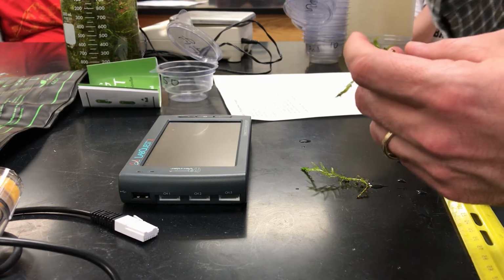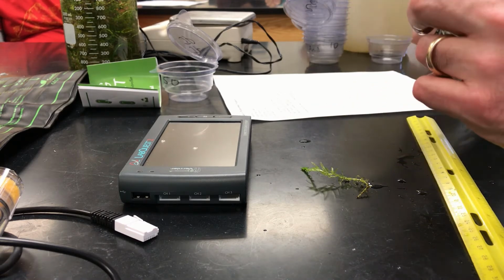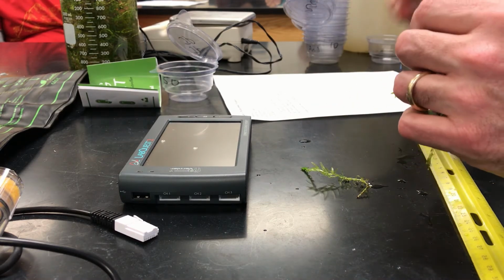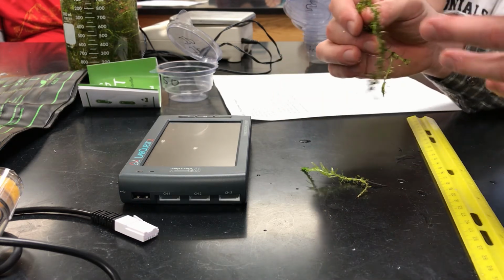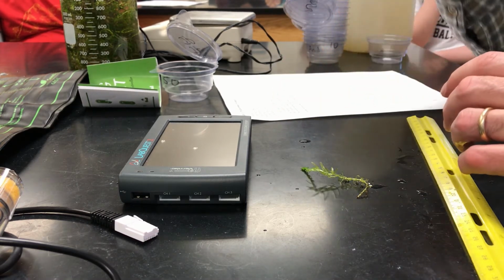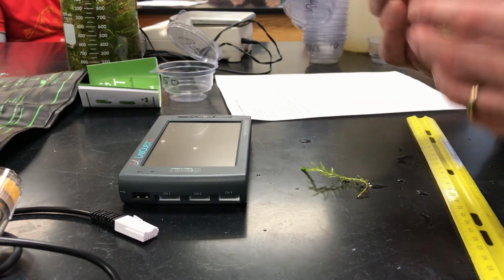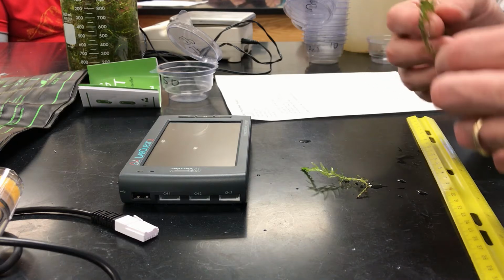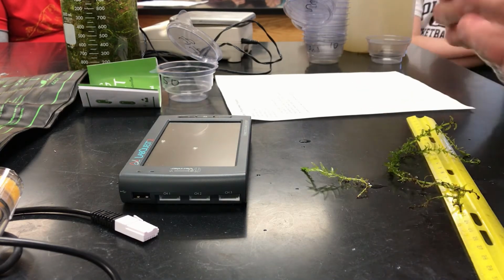And this is something that you can use to standardize cup to cup, because I know that sometimes there are protocols that say cut down the stems, but that also could damage them. Some would be damaged, some wouldn't. Are you cutting them in equal ways? I would say either pick by mass, which will be tough because they're pretty light and there's water clinging to them, or by length, which is also tough because they're awkwardly lengthed and they're not all quite the same.